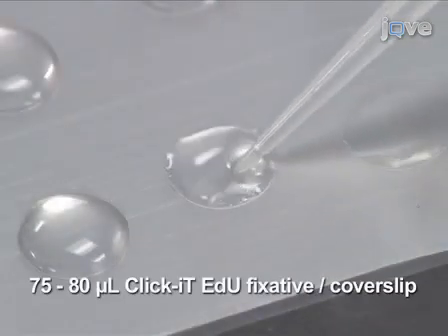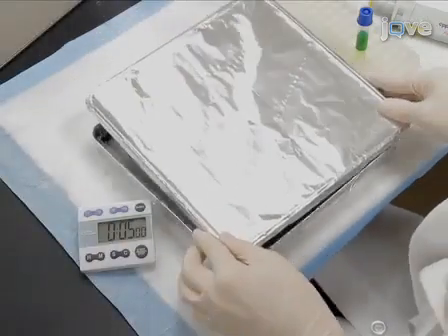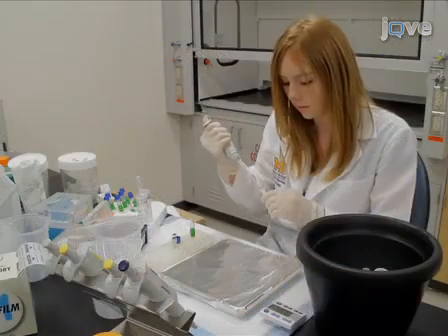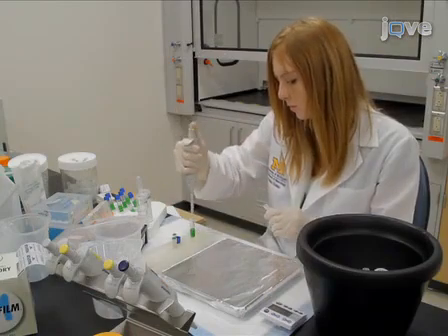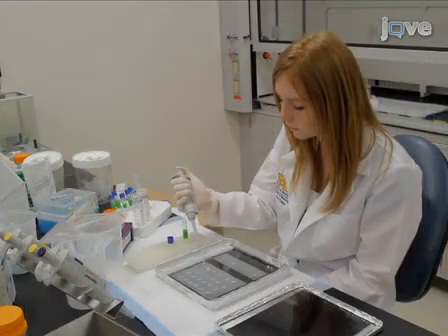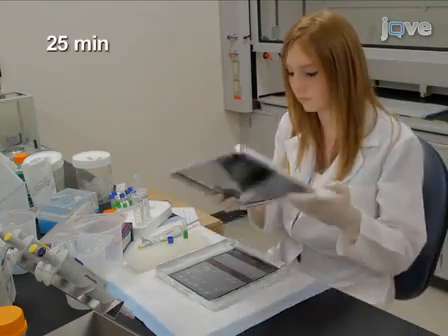Post-fix the neurons with 75 to 80 microliters of Click-iT EDU fixative per cover slip. Incubate at room temperature for 5 minutes. During the post-fix incubation, dilute the reaction cocktail with an equal volume of Click-iT EDU fixative. Add the reaction cocktail to each cover slip. Cover to protect from light and incubate at room temperature for 25 minutes.